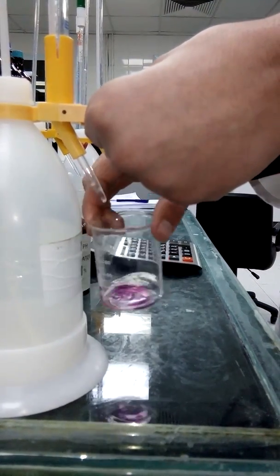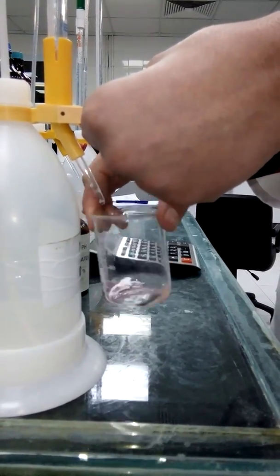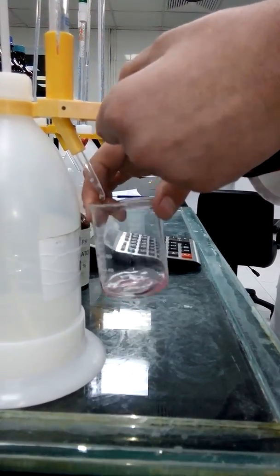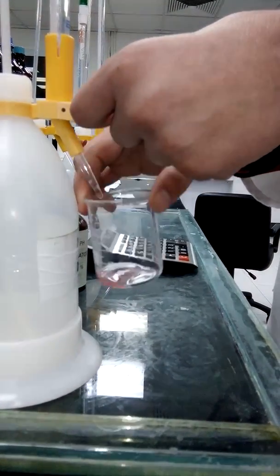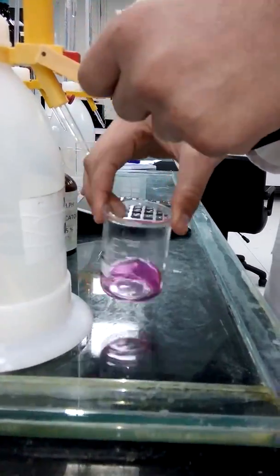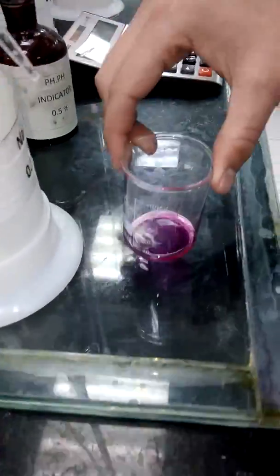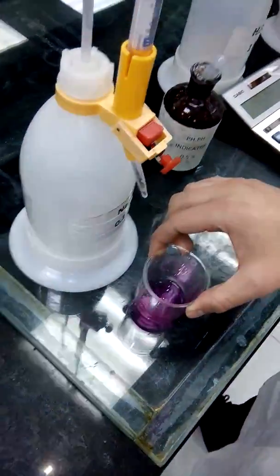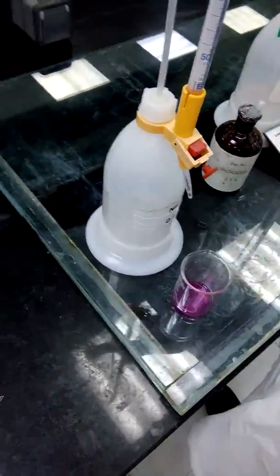Carefully, until we reach the endpoint color. This is the endpoint color for apple drink acidity determination.